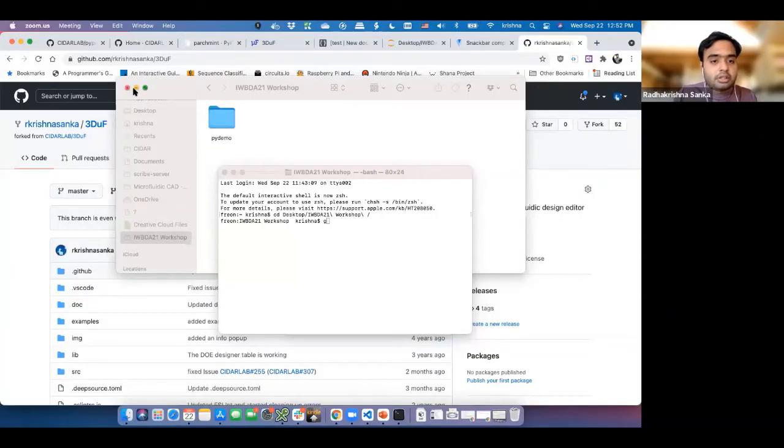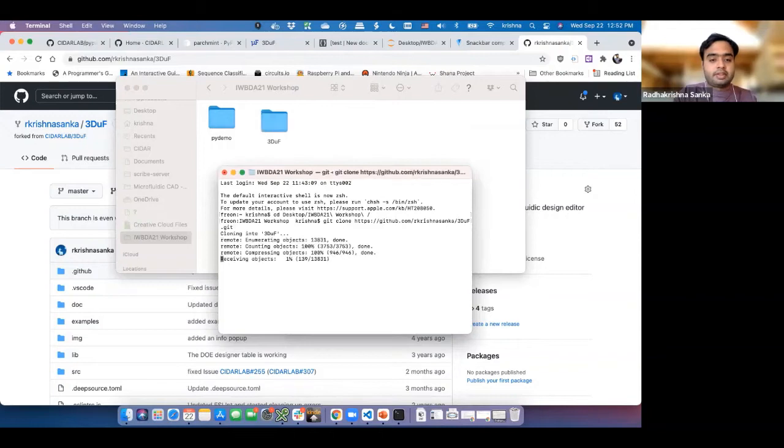So in order to do this, let me share my screen. Sorry about that, I accidentally closed everything. Okay. So now I'm just going to clone the repository, git clone. So I ended up cloning this repository here.